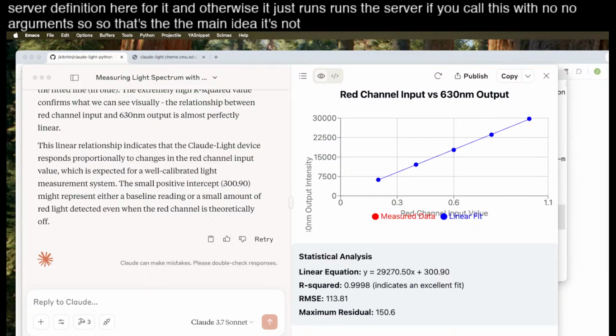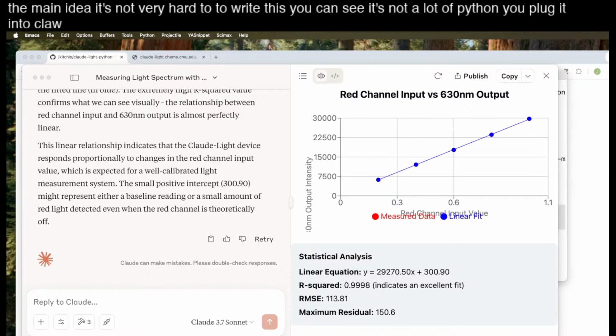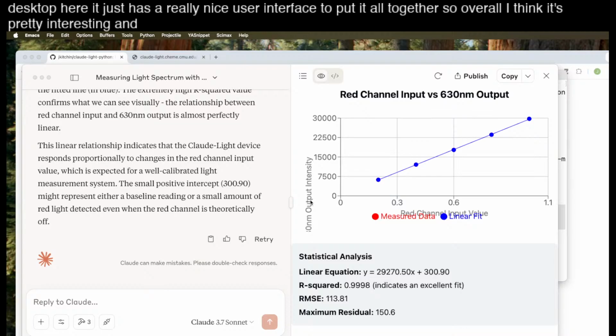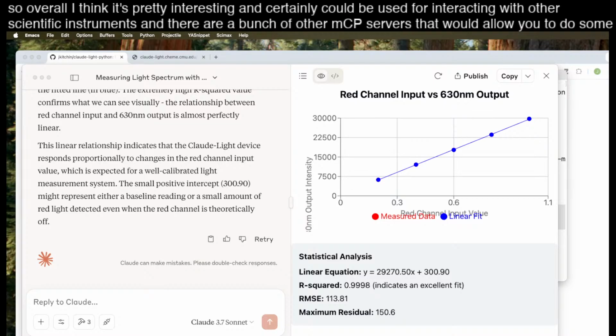It's not very hard to write this. You can see it's not a lot of Python. You plug it into Claude Desktop, and then you can run Claude-Light from Claude Desktop. Of course, you can use functions and tools in your own Python script. It's not necessary to use Claude Desktop here. It just has a really nice user interface to put it all together. So overall, I think it's pretty interesting, and certainly could be used for interacting with other scientific instruments, and there are a bunch of other MCP servers that would allow you to do some other interesting things.